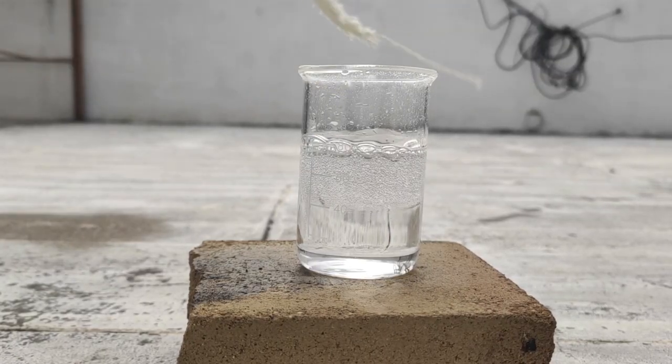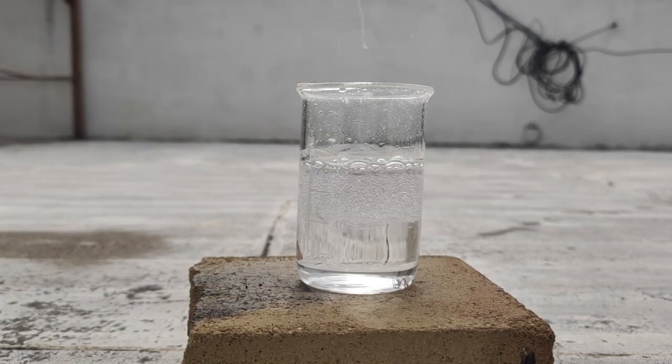Let's put in a clear liquid. Here is the cotton cloth. So let's see how the piranha solution works.